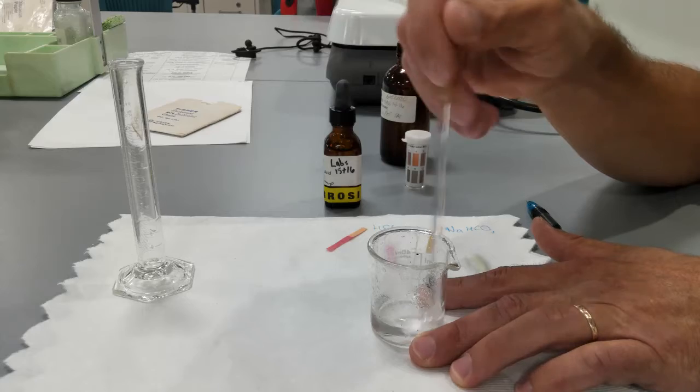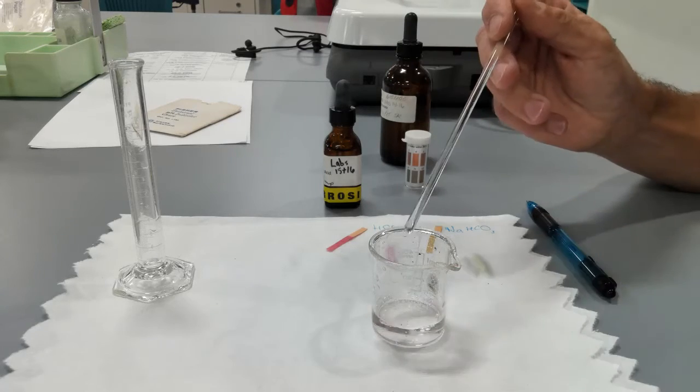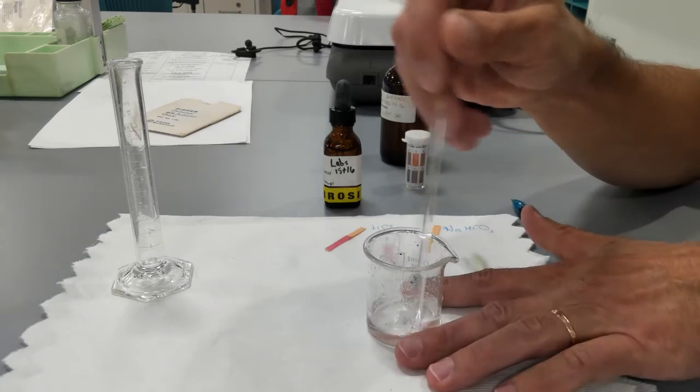Less and less. Good. Less and less bubbles.